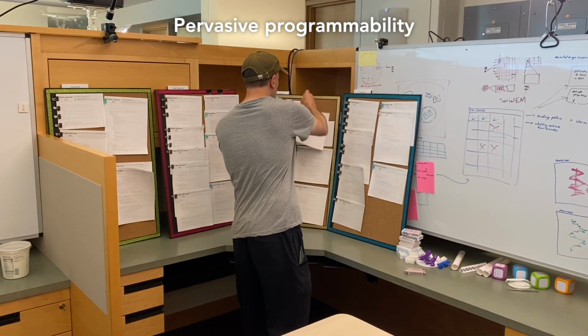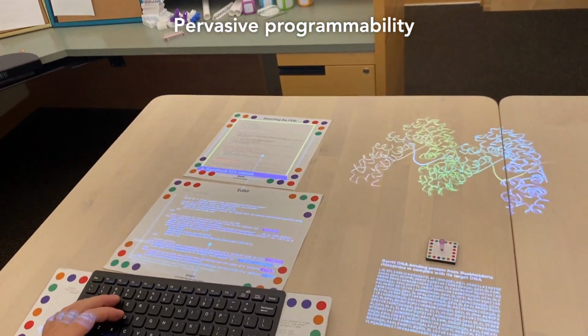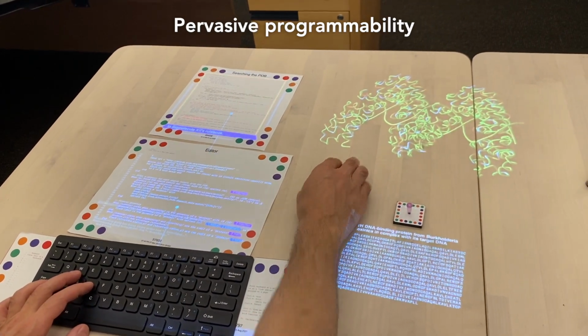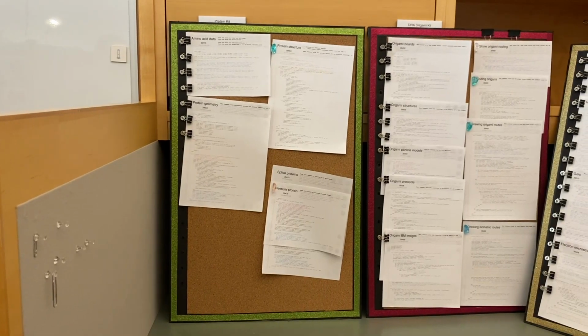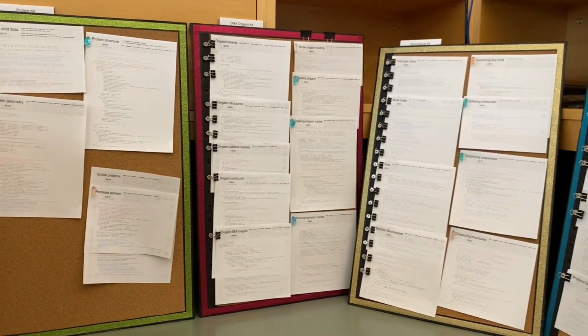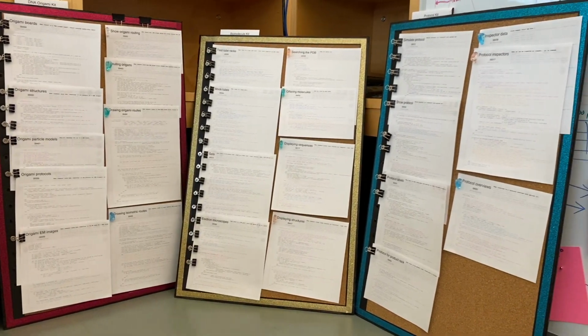This entire set of tools that you've just seen was made in exactly this way, by editing the pages on those posters there, any of which can be changed live at any time by anyone right while we're using them. What you see on these posters is the entirety of this prototype. There is no code base in GitHub. Everything having to do with biomolecules is literally just these 20 or so sheets of paper.